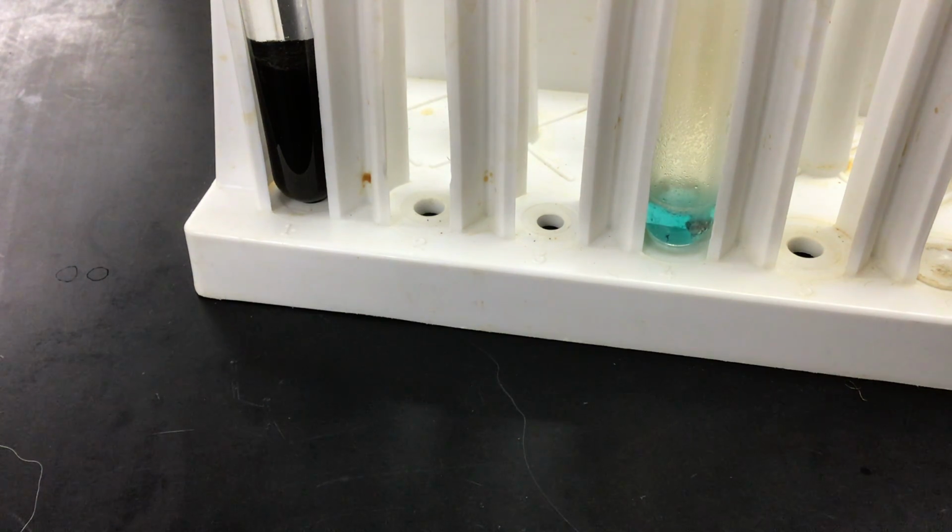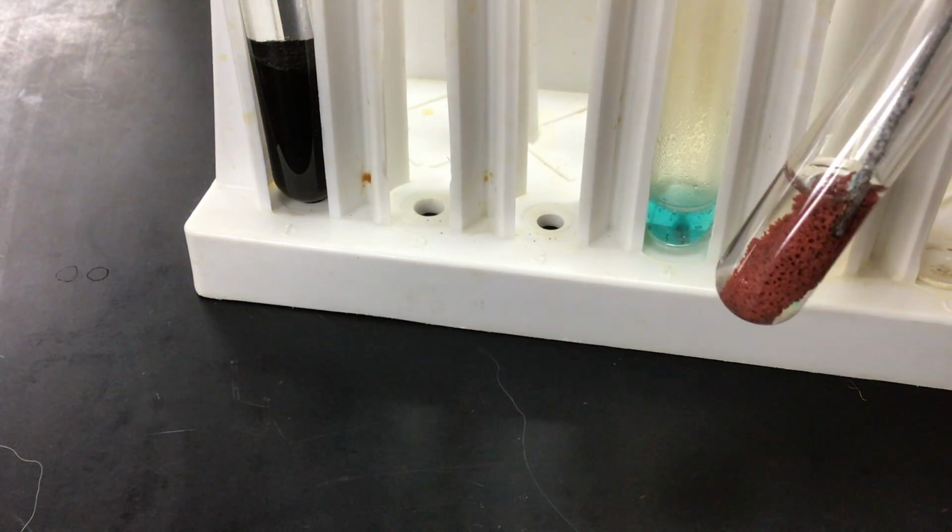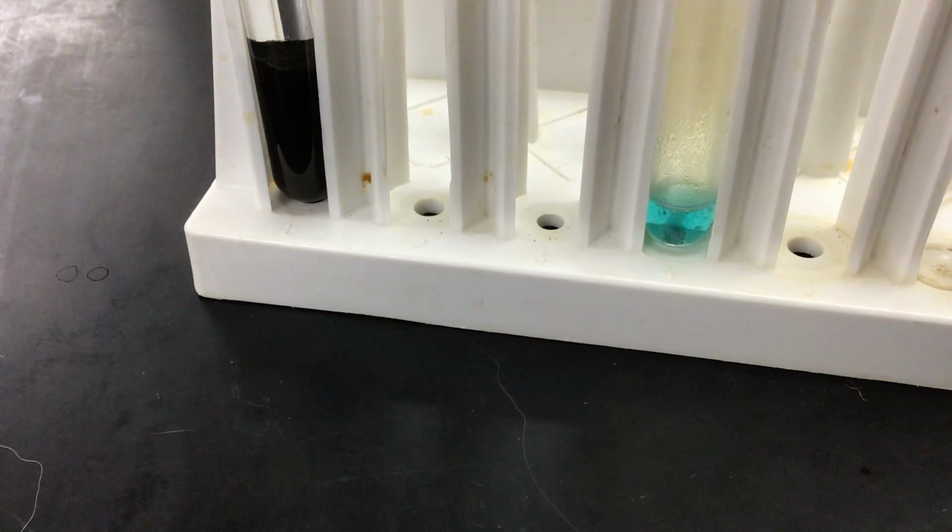So this is the completion of the copper cycle. Now this very last final confirmation of copper is something you don't have to worry about in the packet. You just needed to worry about when it got to this red solid here. But we just did the confirmation to show that indeed that red solid that did form at the end of step 5 was copper. And that's what I'm going to do for students that show up to class.